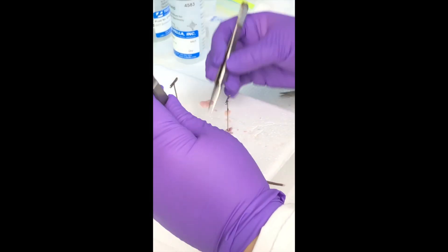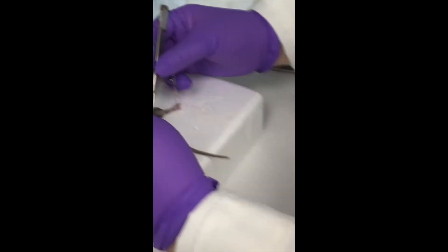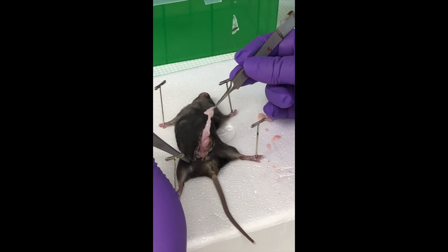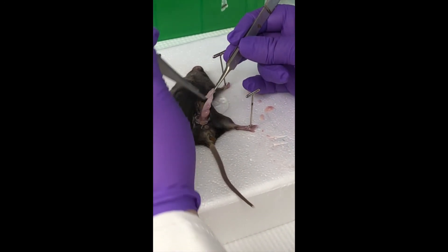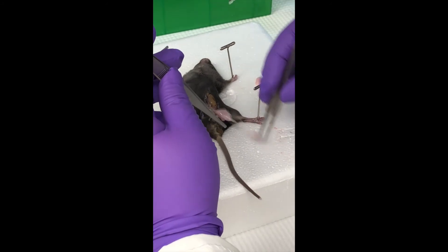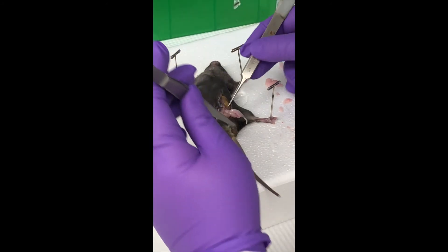This side I kind of cut jagged there. But again, there's the bladder and here's that fat pad that I'm going to pull. And there's the testy — perfect, comes right out. And now I'm going to start just kind of getting that fat out of the way.